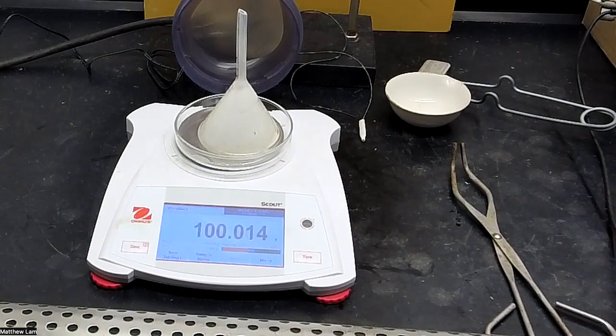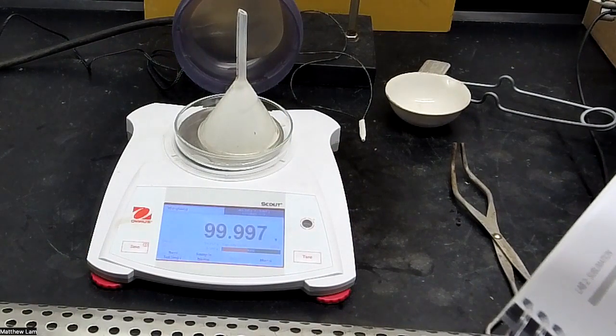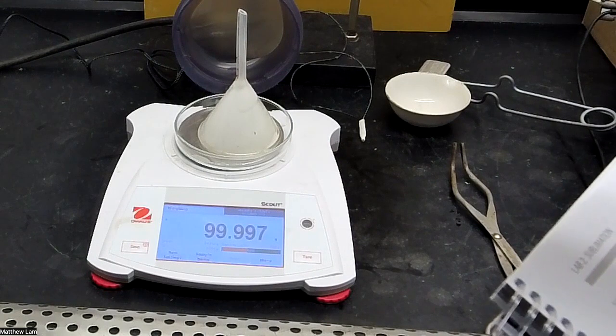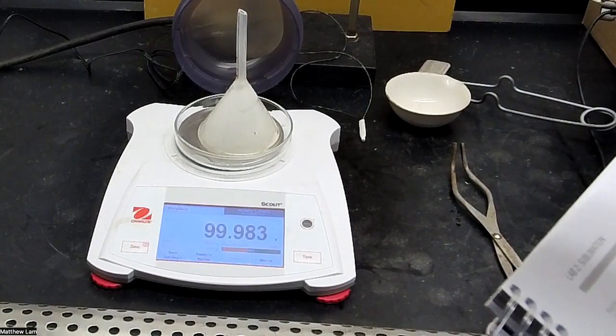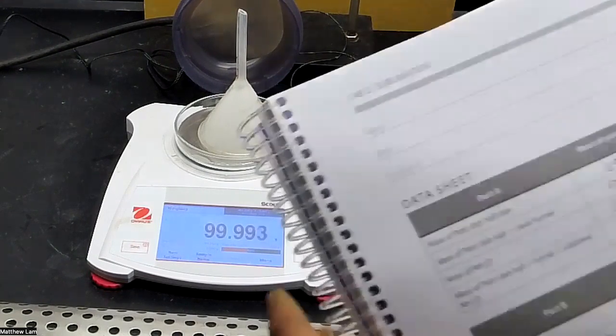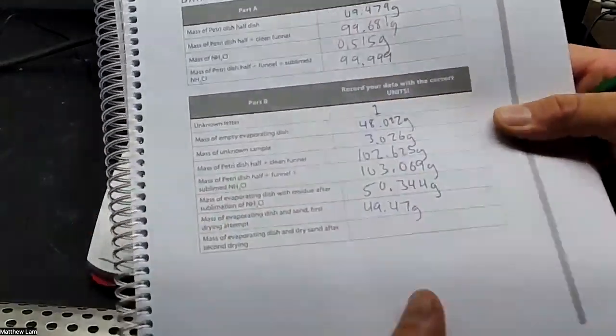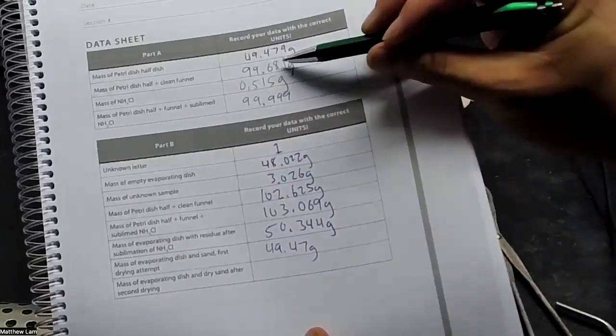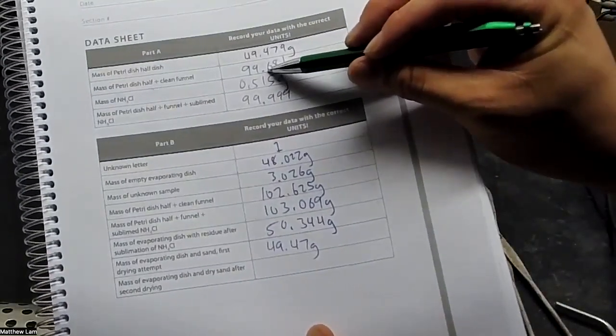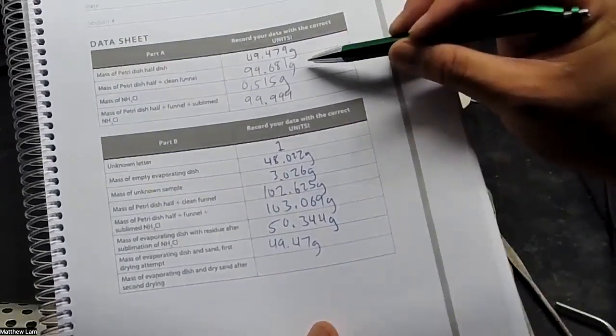And we're going to get our final mass to be, looks like 99... I'm going to say 999, just for fun. So in the last part, 99.999.